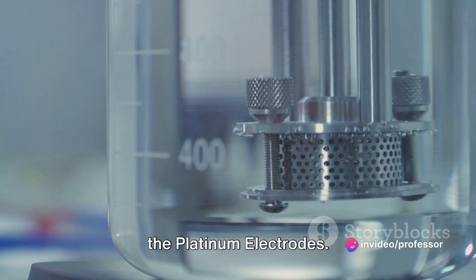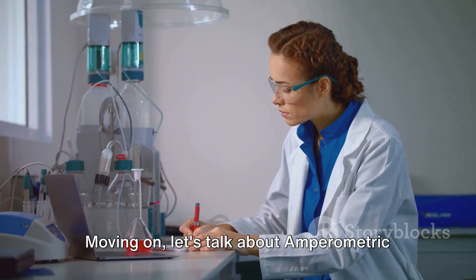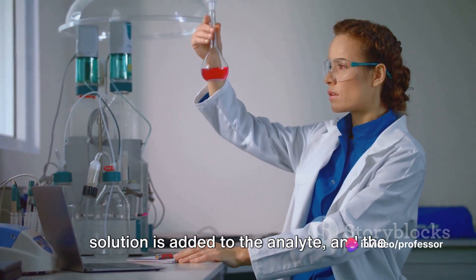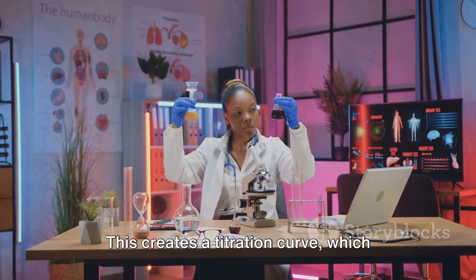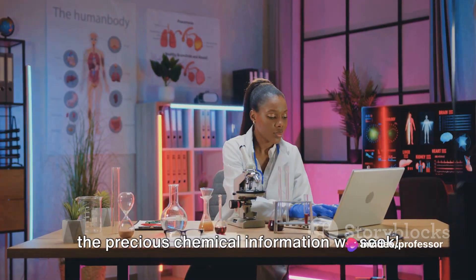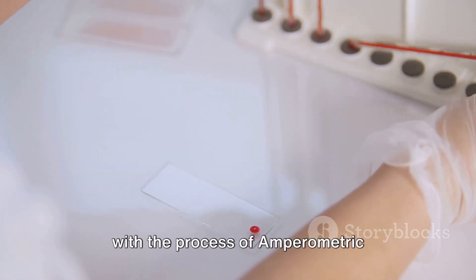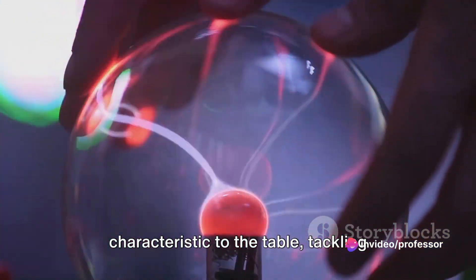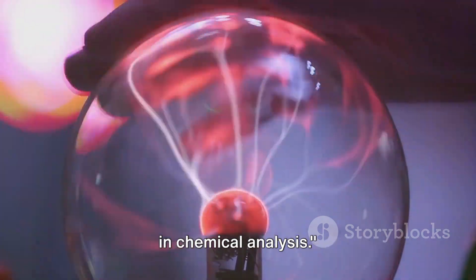Last but not least are platinum electrodes — solid and robust, making them ideal for studying reactions involving gases. Moving on, let's talk about amperometric titration, another vital component of amperometry. This is a process where a titrant solution is added to the analyte, and the current is measured as a function of the volume of titrant added. This creates a titration curve which helps us determine the concentration of the analyte. Different electrodes and titration methods make amperometry a versatile tool in chemical analysis.